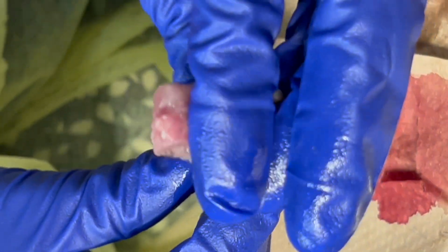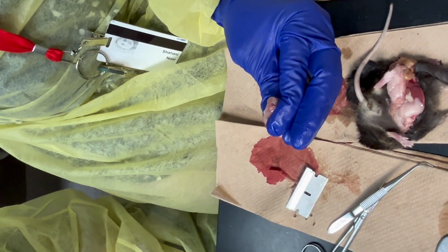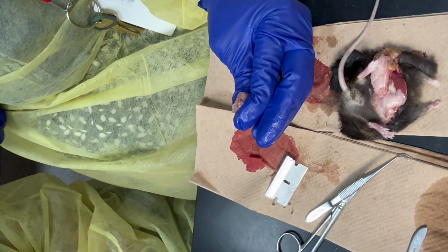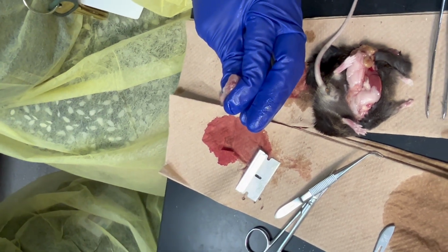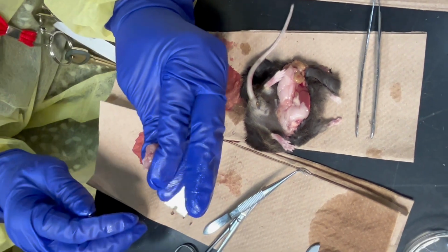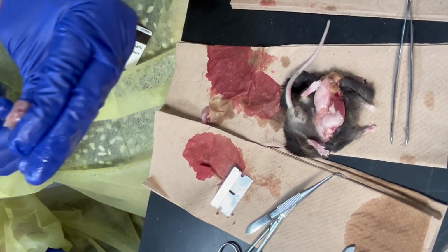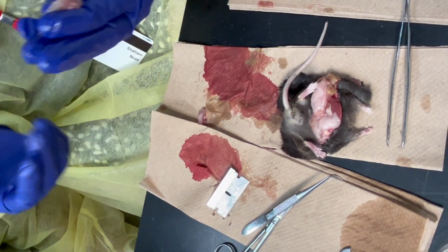Because remember, as you go down, it's almost like a cauda equina, and that's where things are much smaller. But this is not your region of interest. When the sciatic nerve synapses, that's actually at the part of your lumbar enlargement. It's a little up. It's not the very far down spinal cord that I'm trying to get anyway. It's just that if I have that tail, even if the spinal cord breaks, I know which way it is. But if I cut too far, sometimes this part and this part would look exactly the same. And that's kind of hard.